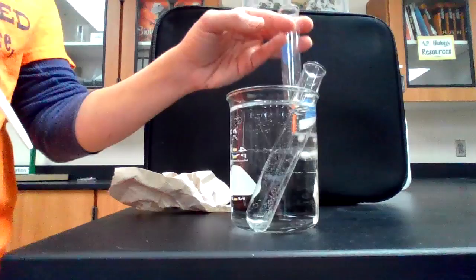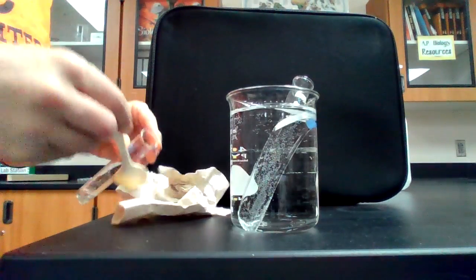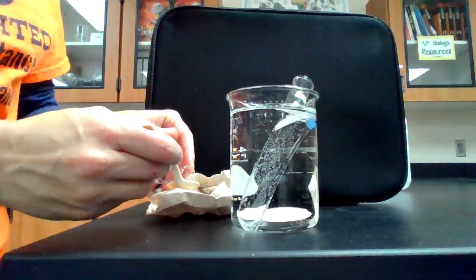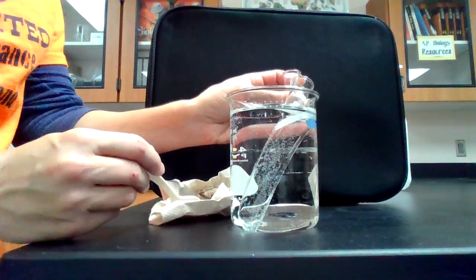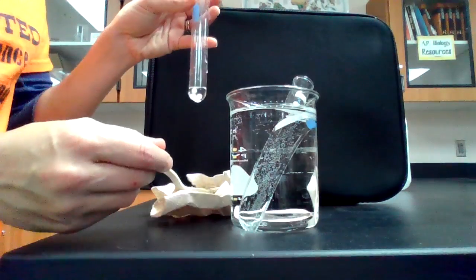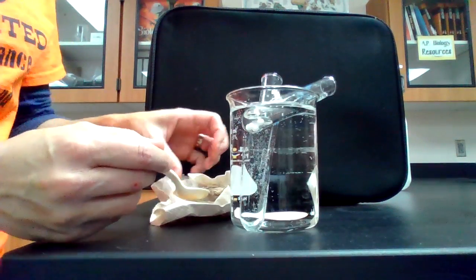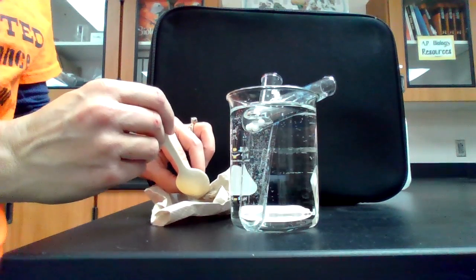We're going to do 5 trials at room temperature. So give me just a second to get one of these little spheres out. And these are just soaking in water. So I'm going to get that extra water off of there. Put those back there so they stay the same temperature. Trying to soak that extra water off the spoon.